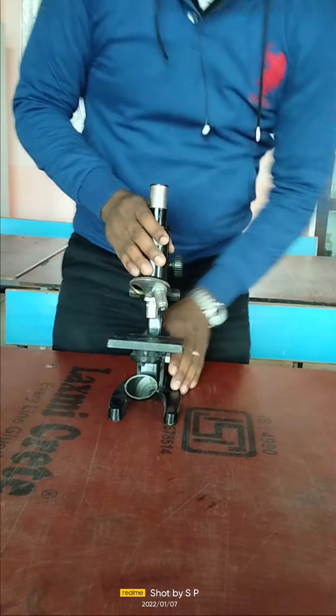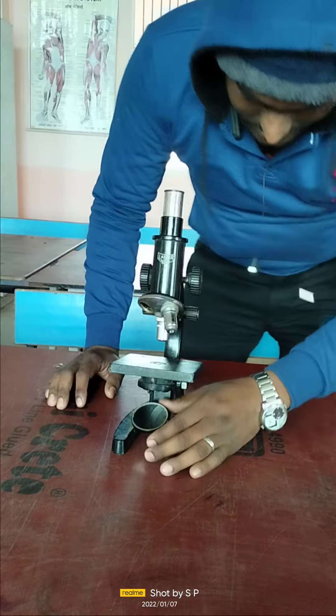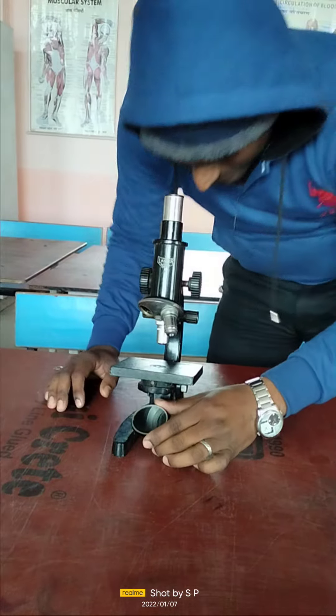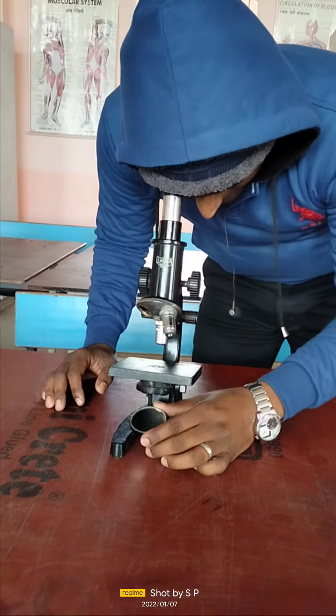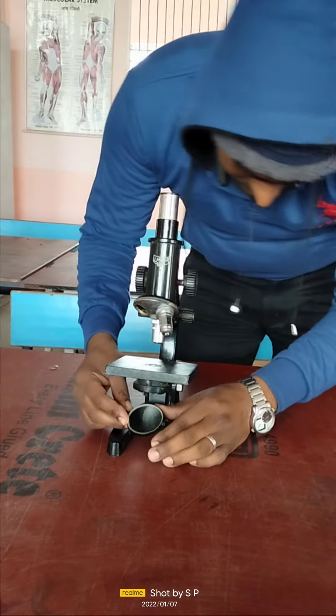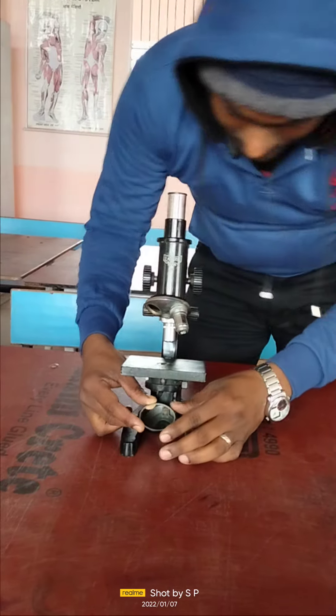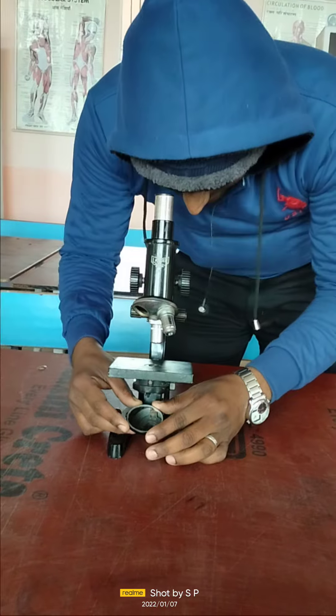Like this, we have to focus the mirror first so that the maximum light may fall on the specimen. We have to adjust it with the help of this, like this.